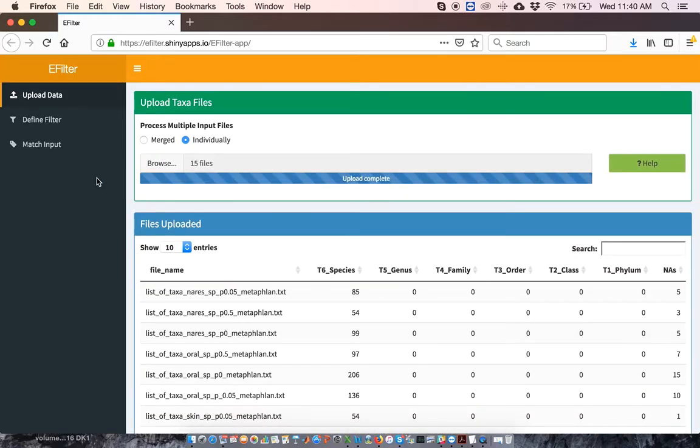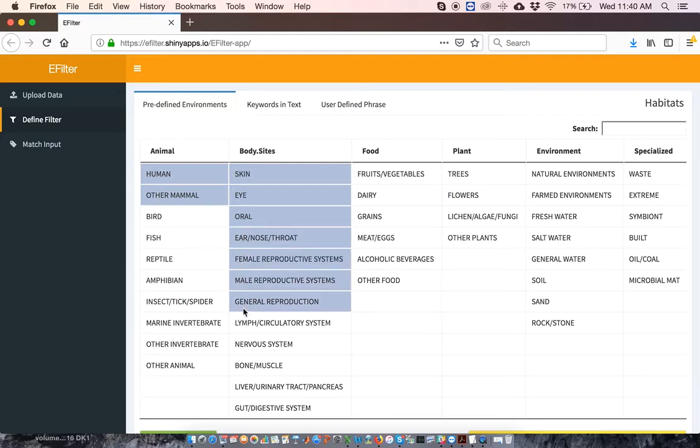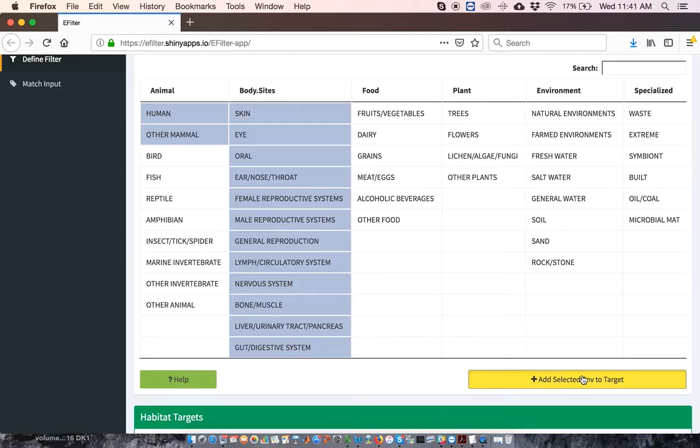The next step is to define your filter. To do this, point and click on the Define Filter tab. Depending on your goal, it's generally advisable to start with broad filters. So for instance, if you have human skin samples, you might want to consider a filter that includes all body sites, humans, and mammals. Habitats can be combined in any logical combination. To do this, click on all of the habitats that you want to include, and then add these environments by clicking the Add Selected Environments to Target button.